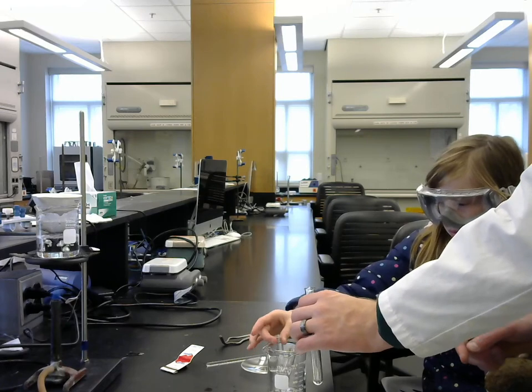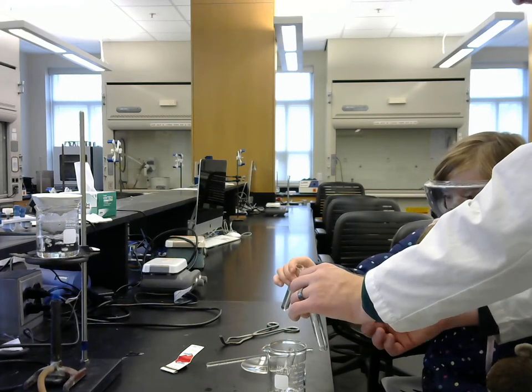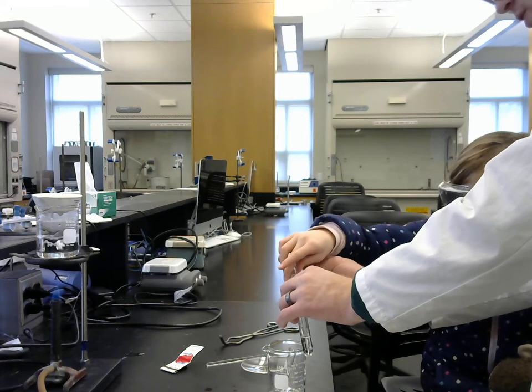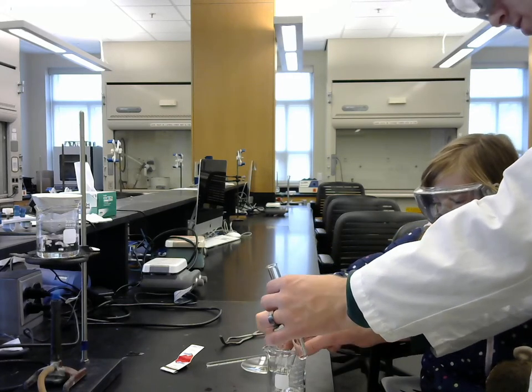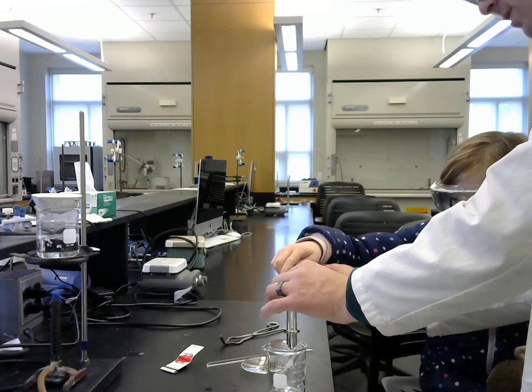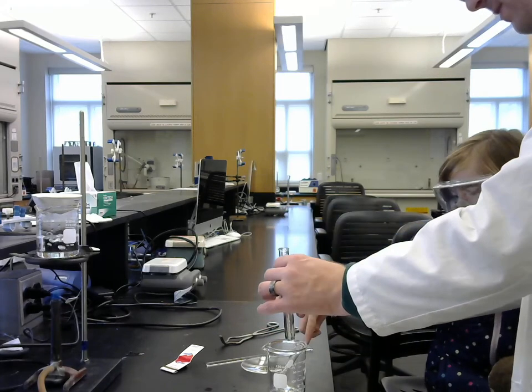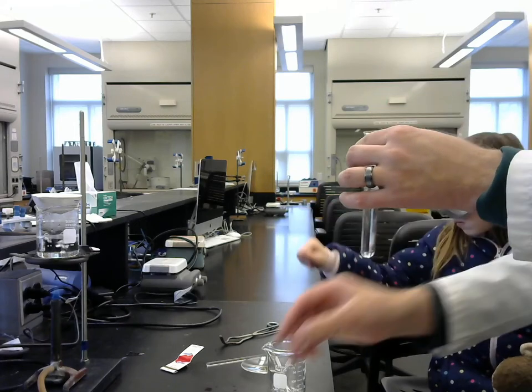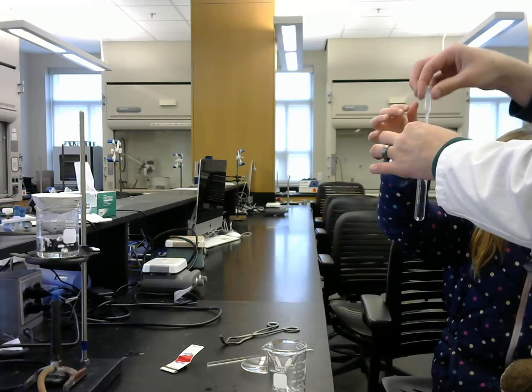Now can you pour both of the contents into this bigger test tube? Try to do it carefully, because I don't want an itchy rash. That's right. There you go. And then we'll dump it. Very good. Hey, there's some stuff in there. Now the other one. Dump it. I think there might be a little tiny bit more of this one than that. That'll be all right. Okay, and we want to mix this really well, so can you just blow bubbles like that?